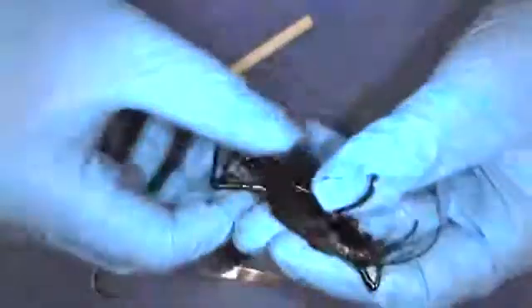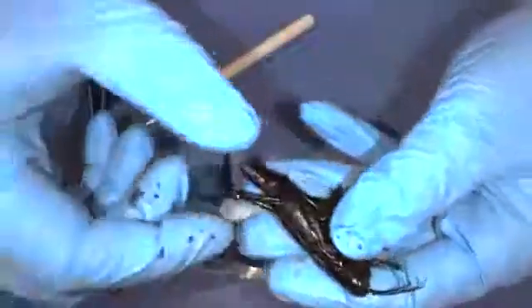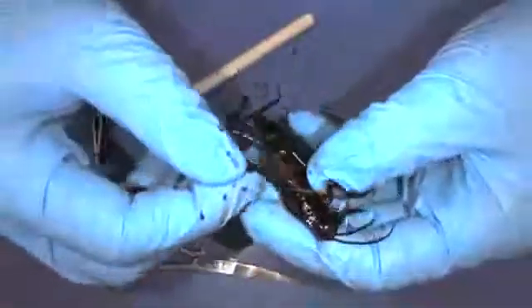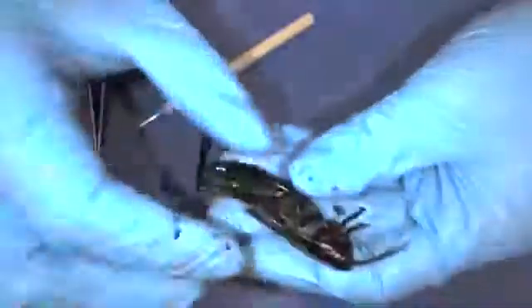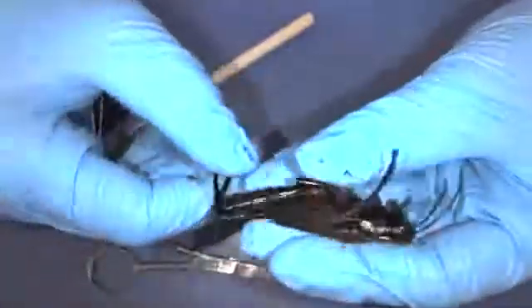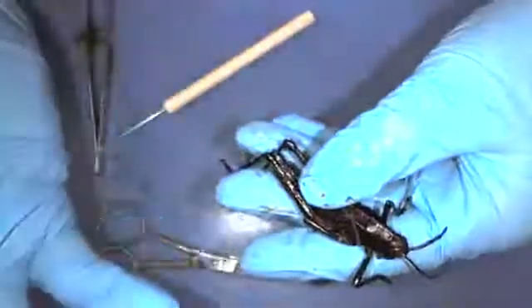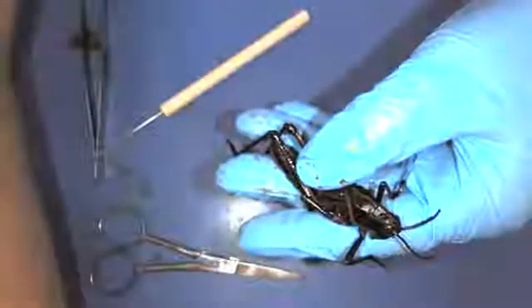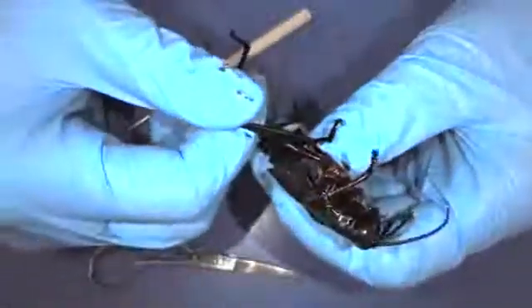Those are some of the main features of our grasshopper. We got to learn about their intricate feeding techniques, how they breathe and how it differs from our body, and their cool adaptations for flying and jumping. Even though some people may think insects are kind of gross, they're really important to different ecosystems — this grasshopper is both eating things and being eaten, making it a vital part of the beautiful environments that make Earth special.